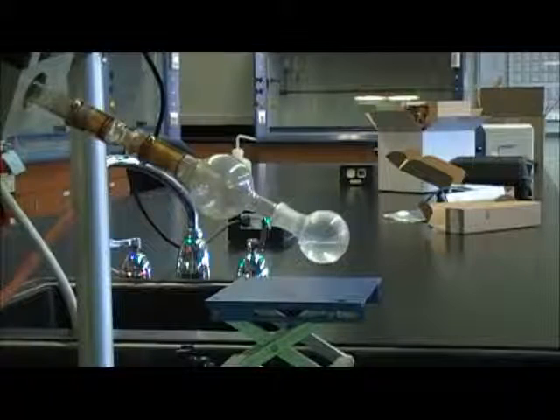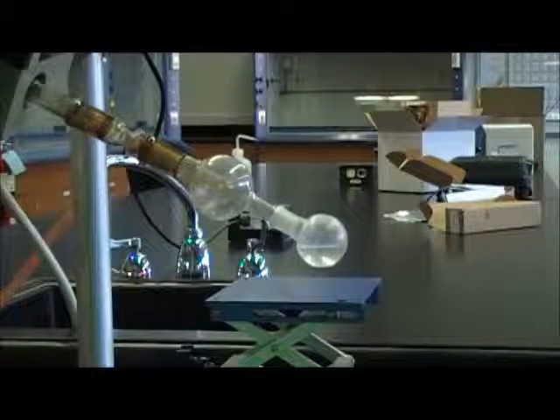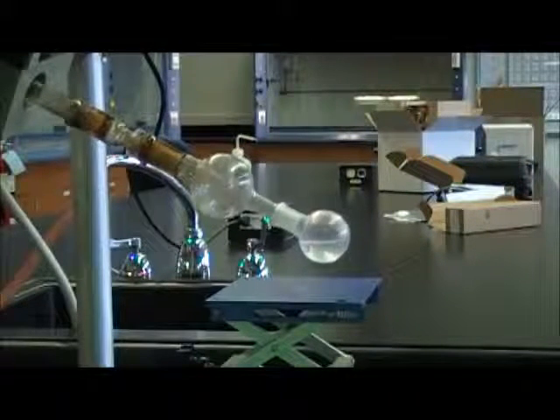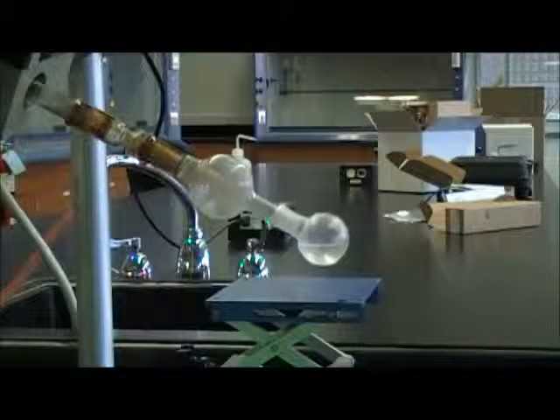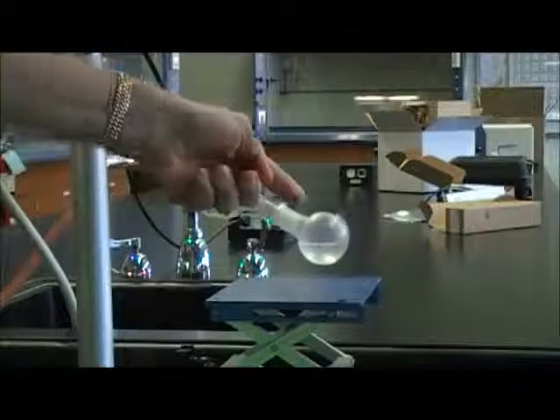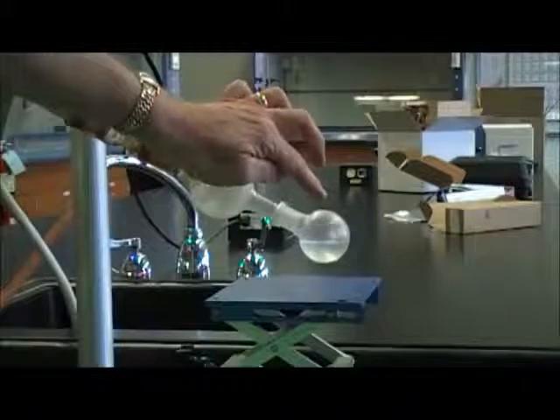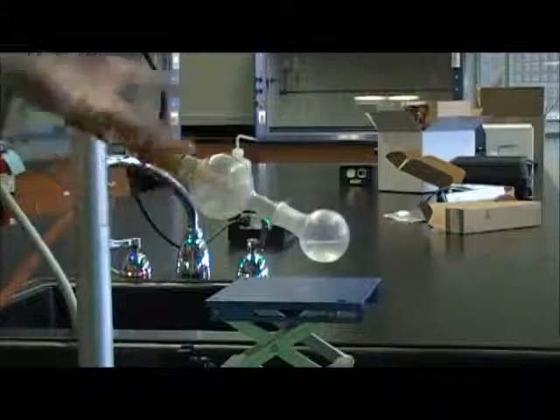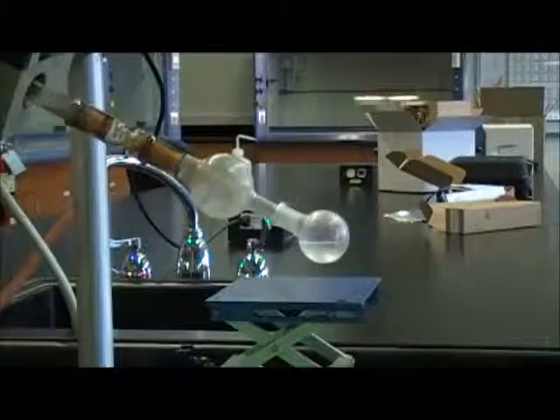The other thing I can do is turn on the rotary part of it. And what that does is forms a thin film of the solvent on the inside of the glass. And that gets sucked out. And every time that thin film forms, it gets sucked out of there.